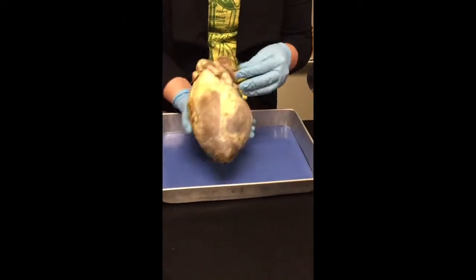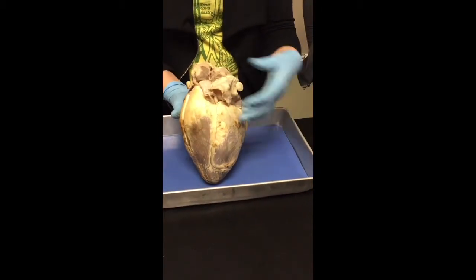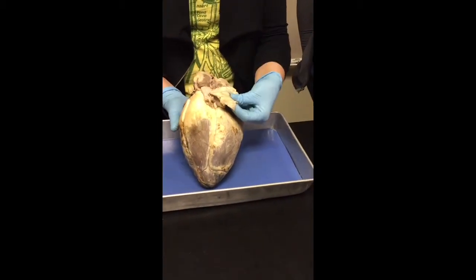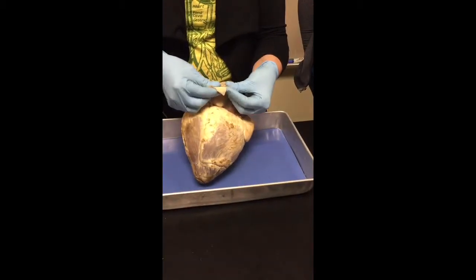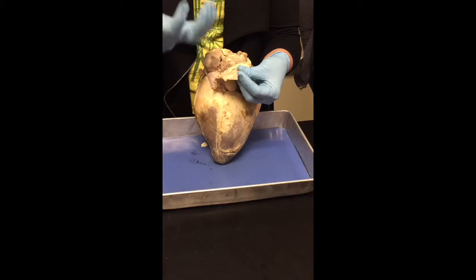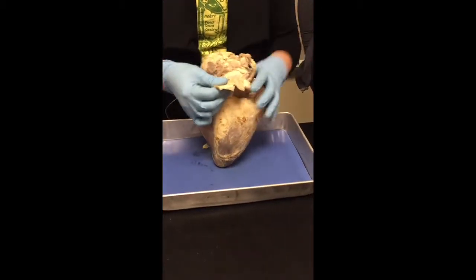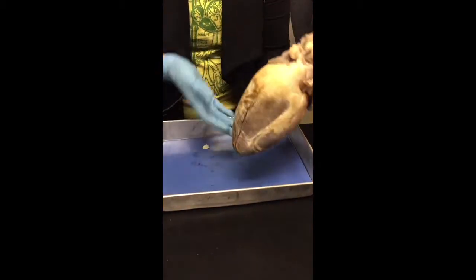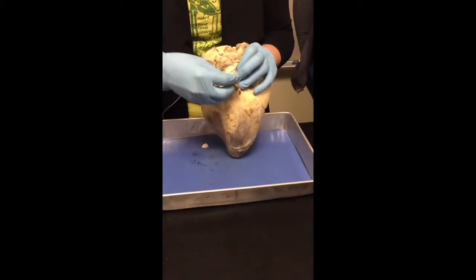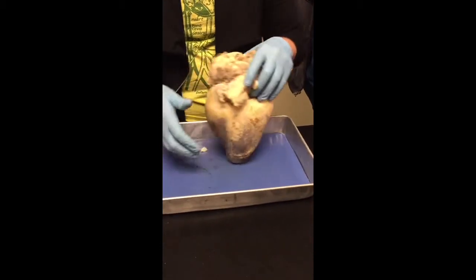Now tissues. All right, so on the back, you can see this kind of flap of stuff, okay? This is called the pericardial sac, or what's left of it at least. So this pericardial sac is a tough, dense connective tissue, and it just plays protective roles. So it just protects the heart. At one point, this pericardial sac actually encapsulated the entire heart, but we had to cut it away so that you could see the heart, okay? So this is what's left of the pericardial sac.